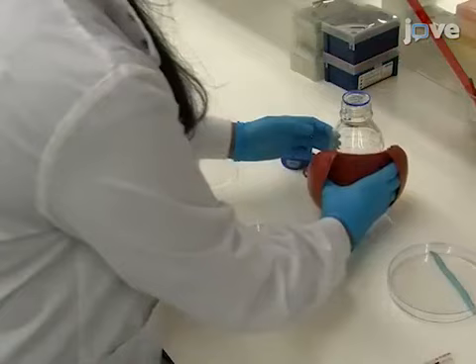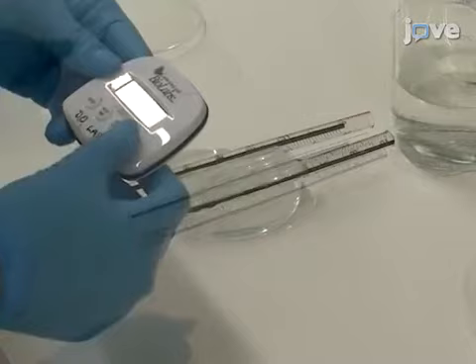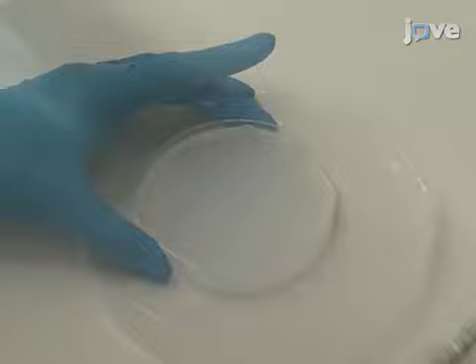After pulling needles and preparing a mold according to the text protocol, cast the mold by first pouring a 2% agarose solution made in fish water into a 90 millimeter petri dish. Place the mold on the petri dish permitting the stacked slide edges to submerge at an angle under the agarose surface. Allow it to set for 30 minutes.